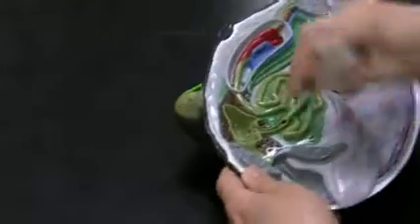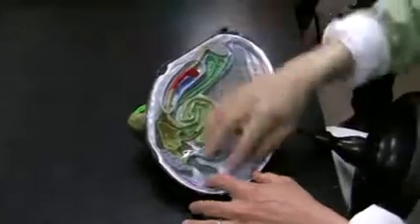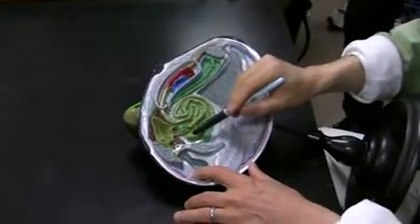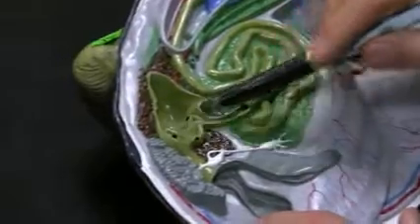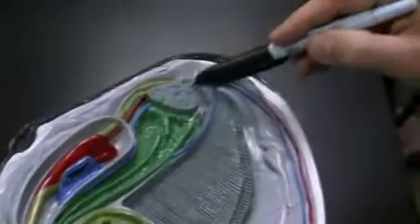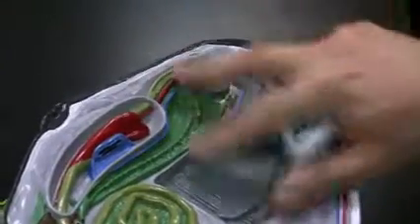This is in the foot. As I said in the lecture, it's like a hatchet foot. So this is the foot right here. They cut the foot just like I did on the dissection. Inside of the foot, you have intestine. It goes back and forth, goes to the stomach, and from mouth, stomach, intestine, and it goes through the heart. And then anus right here. The mantle cavity right in this area.